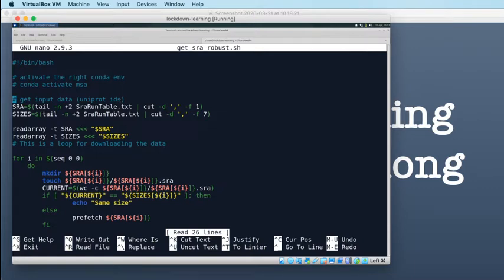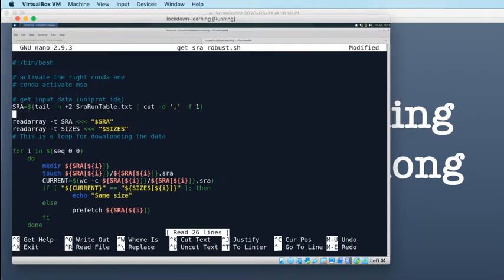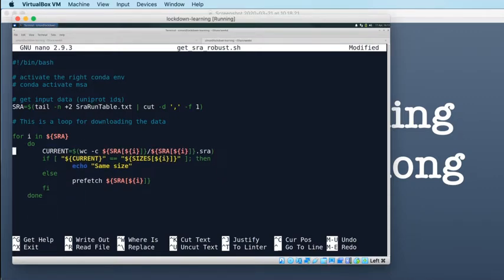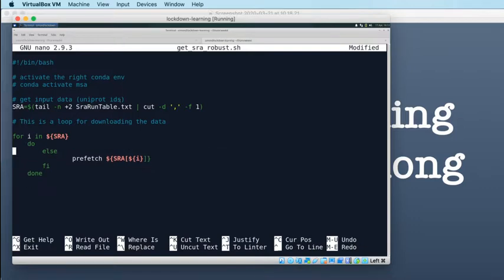Okay. We don't need the file sizes anymore. So let's change all of this. We don't need all of this. And then we want for i in SRA. So there's a lot of complications here that we really don't need. So we don't need that or that or that or that or that or that. We just need to do this.